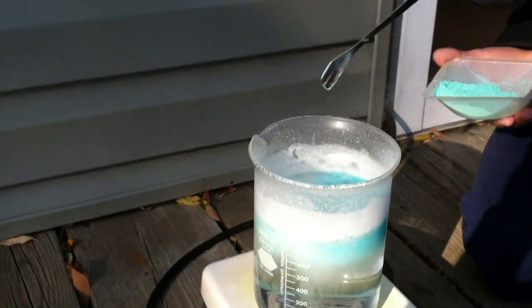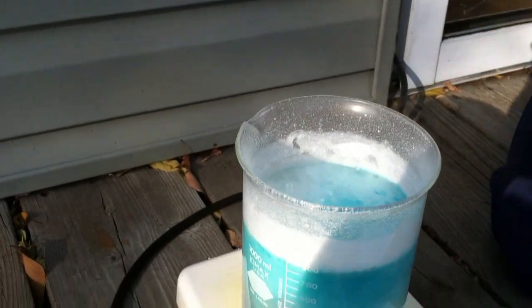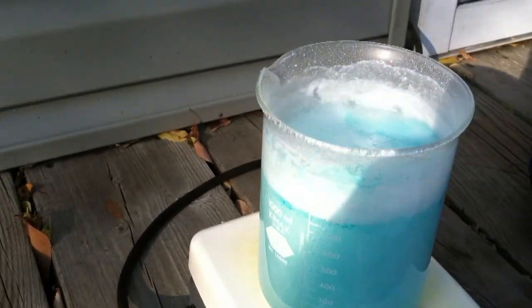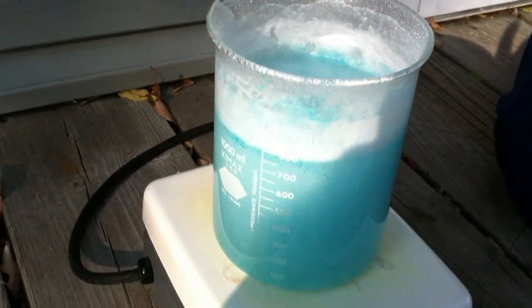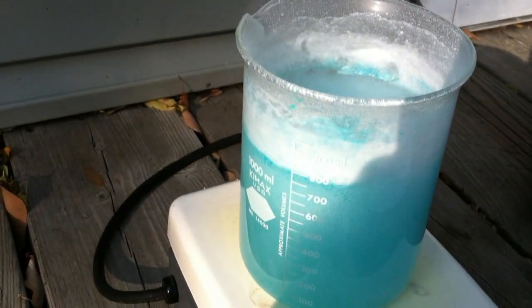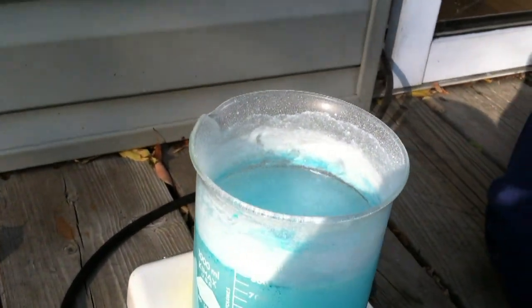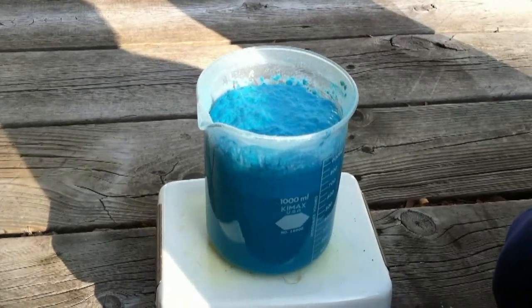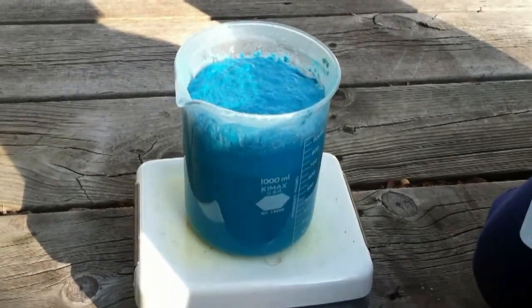Okay, starting with the fizz. Kind of like Coke. Wow, look at that beautiful blue color. It's like the ocean.